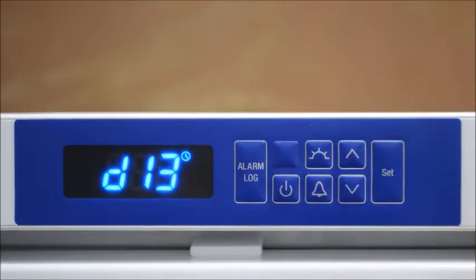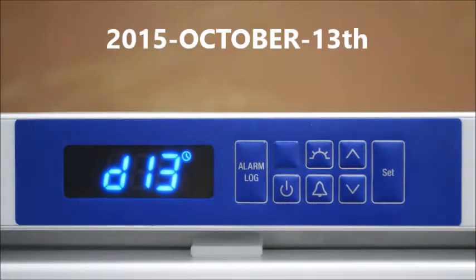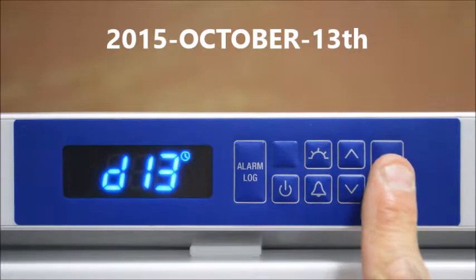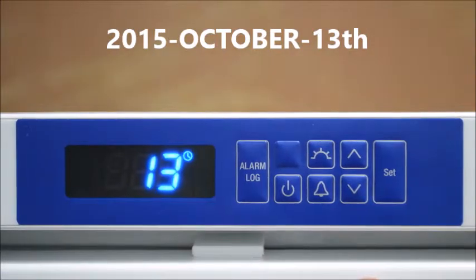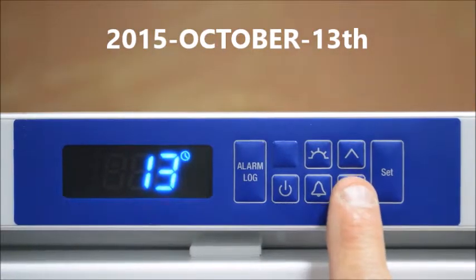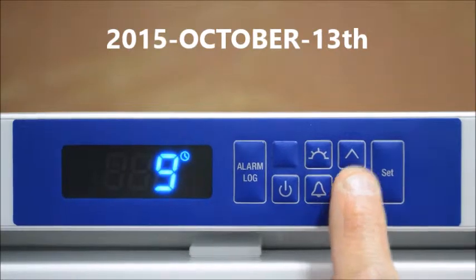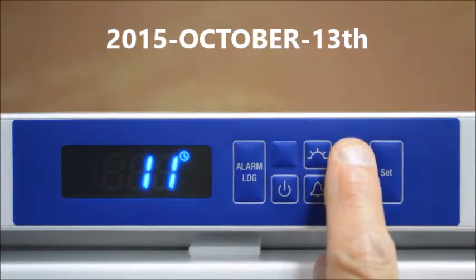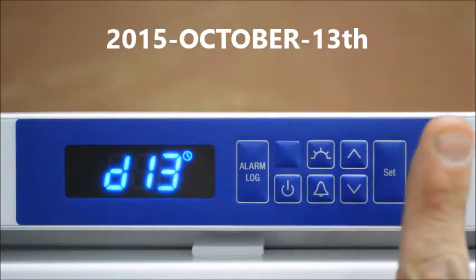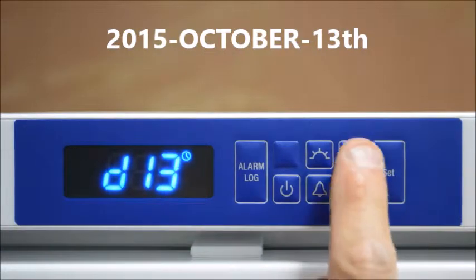Pressing the up arrow again we can now change the date. Press the SET button and scroll up and down until we find the correct date, then press the SET button and we now have the date programmed into the system.